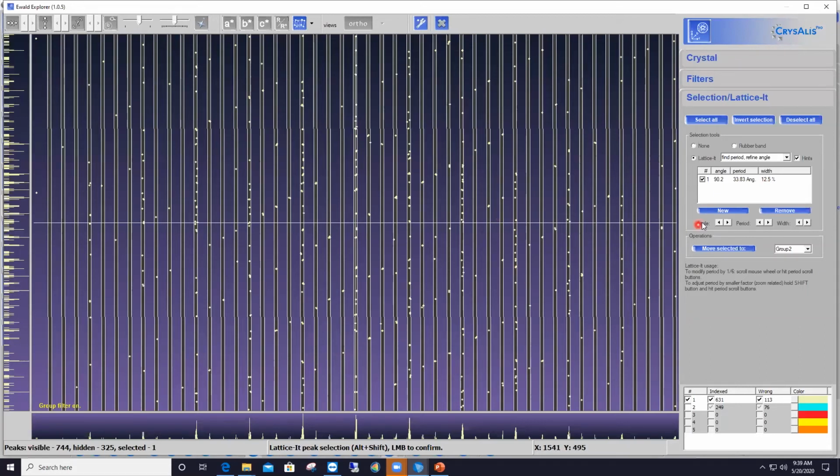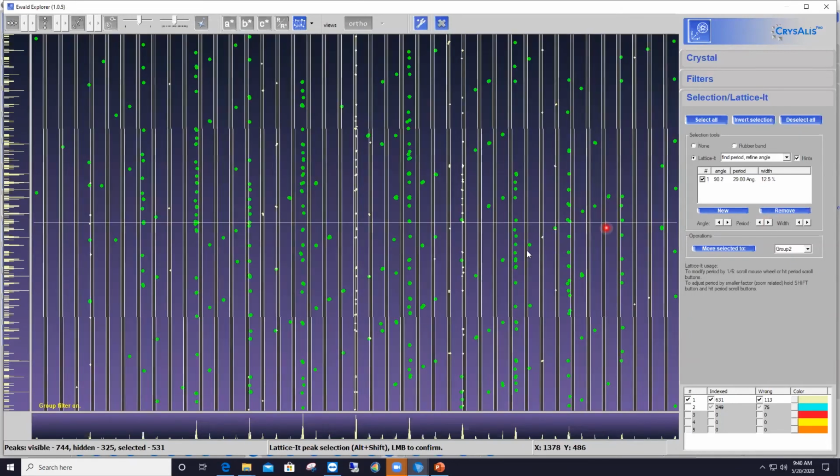To do that, I will move to the right-hand side panel, and I'm going to use these buttons here for the period between rows. The left pointing arrow will make the distance between the rows smaller, and the right pointing arrow will increase the distance between rows, and that's what I'm going to do here. Okay, so here we go. I'm clicking on that right pointing arrow button once already, and you see that all the rows have shifted. So by increasing the period here, it amounts to me grabbing the pattern of rows on the left and on the right and pulling on it.